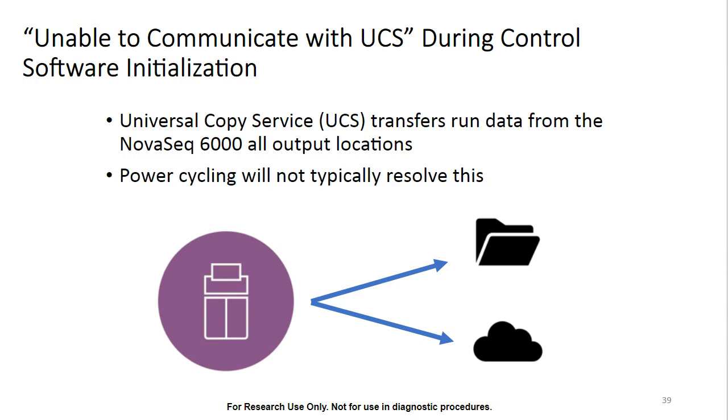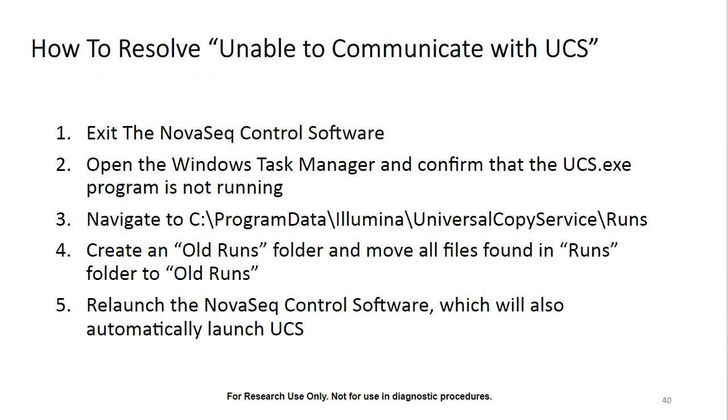So what we'll want to do is go ahead and exit the NovaSeq control software. And then let's open up the Windows Task Manager and confirm that the UCS.exe program is no longer running. From there, we can navigate to the C:\ProgramData\Illumina\Universal Copy Service\Runs folder. And let's go ahead and create a new folder, and we'll just call it Old Runs. And then all of the files that we have located in the Runs folder, go ahead and transfer them into that Old Runs folder. Once this is done, we can relaunch the control software, and this will automatically launch UCS and should hopefully resolve the issue.